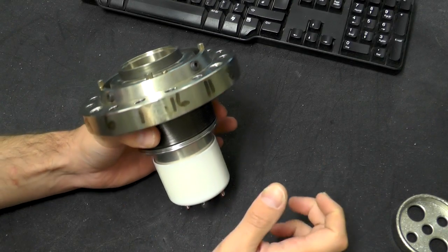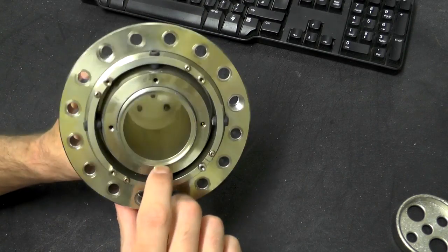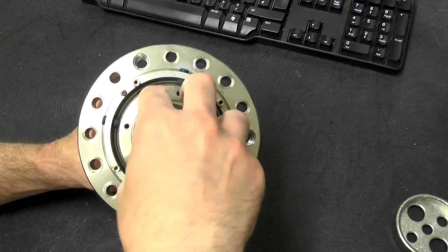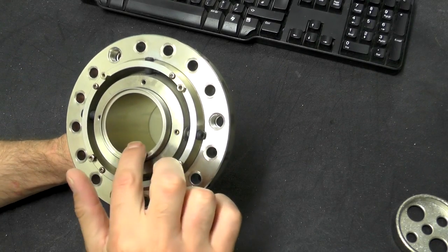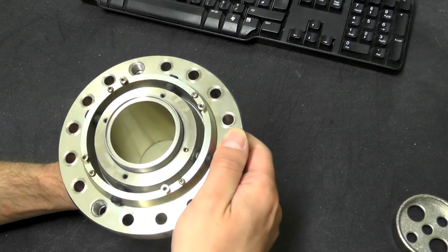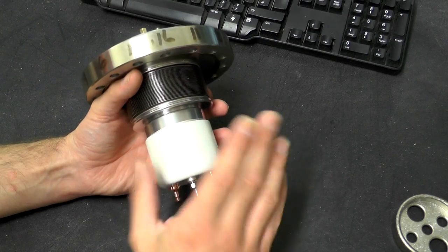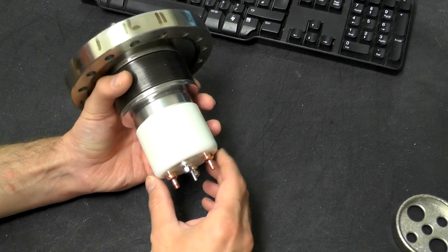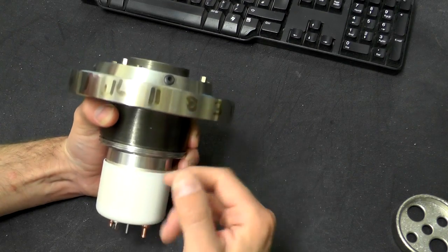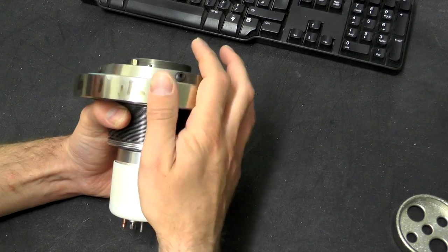This part is the bit that holds the filament for the electron gun. The connections into the top here would have been on a large socket with a big cable that would have plugged in here, probably screwed onto that thread as well. There are a number of connections down into the bottom. This section is all under vacuum, but you also need to adjust the position of the filament in relation to the holes and apertures.